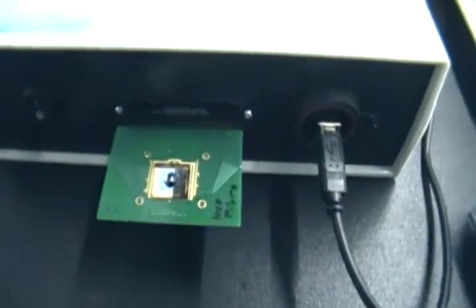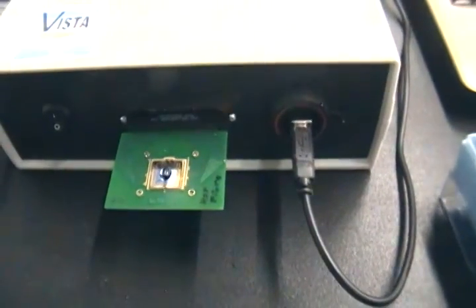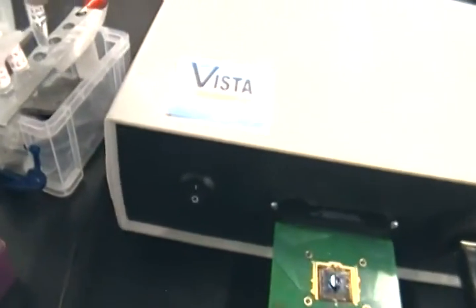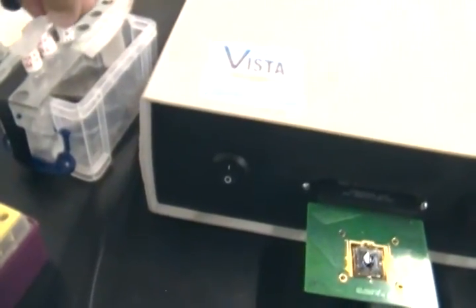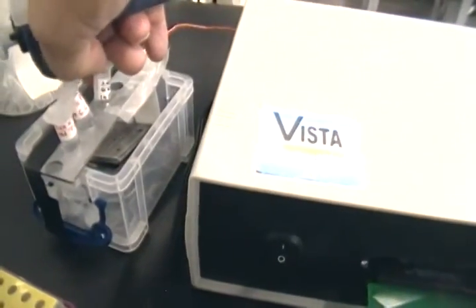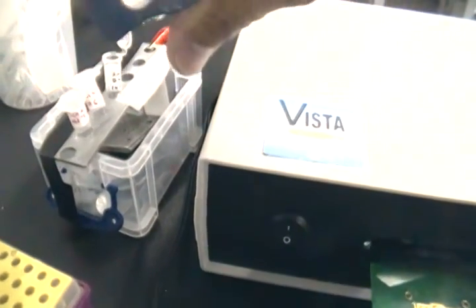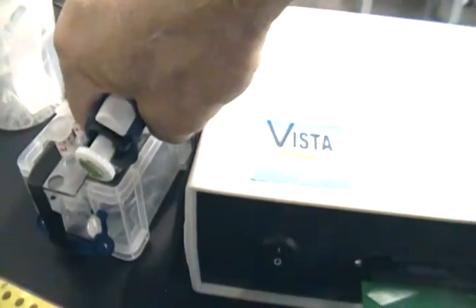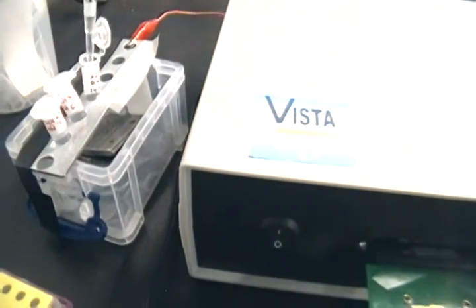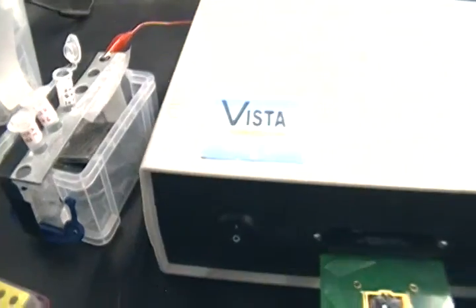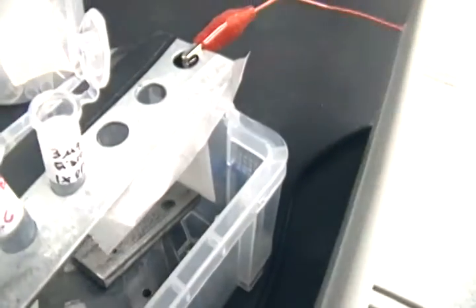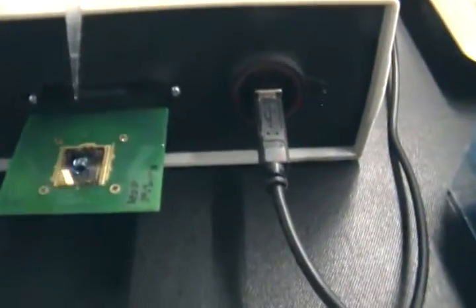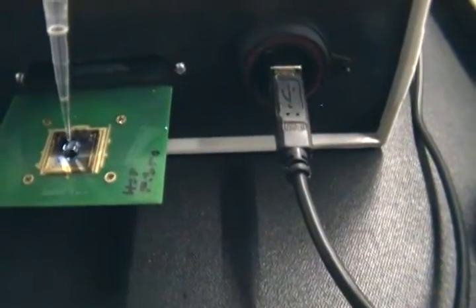And we'll see what happens. Now, keep in mind, this is very sensitive. We're looking at minute changes in concentration and very minute changes in voltage. So one of the things we need to do is make sure that we always ground every tube. Every time we use it, we ground the pipette, I ground my fingers. They're all grounded to the back of the nanobiosensor so that they all have the same basal level of charge to them. All right. We're now adding 20 microliters.